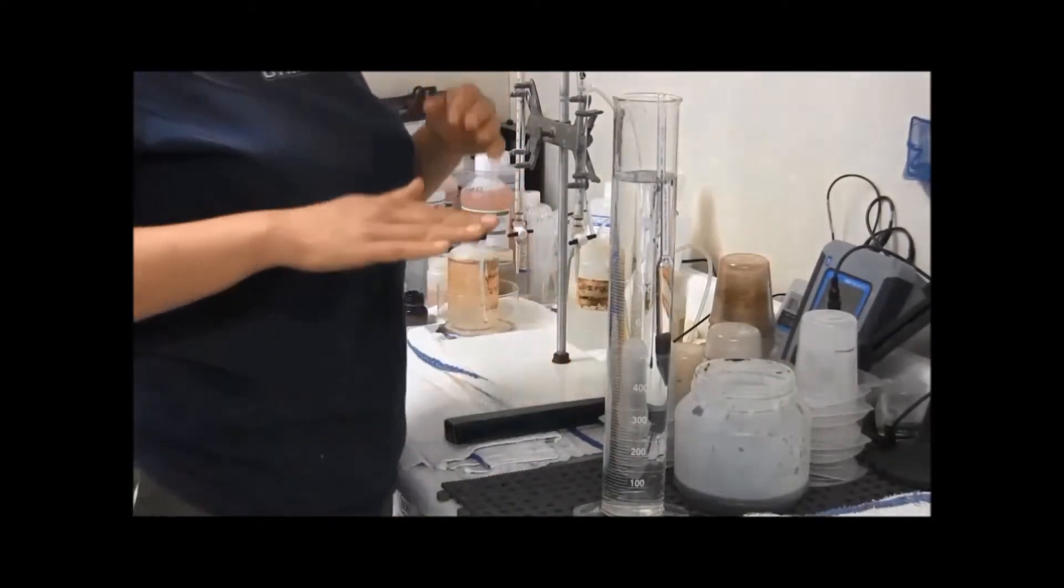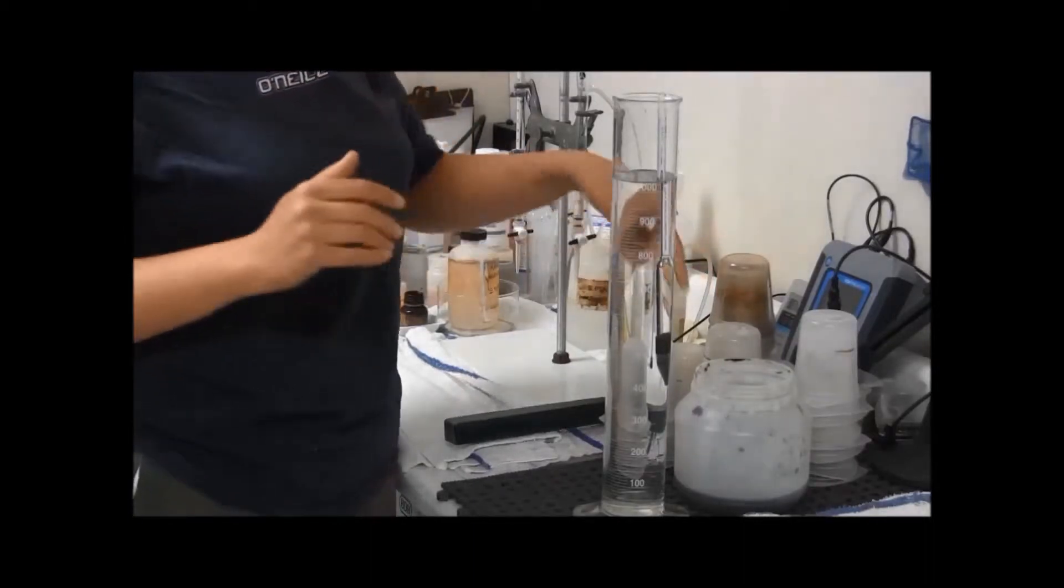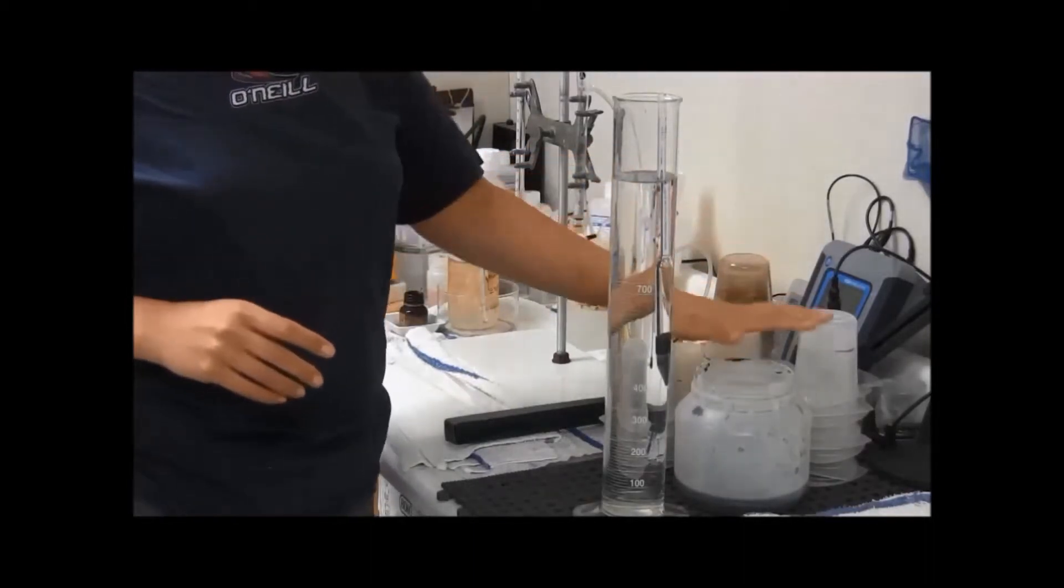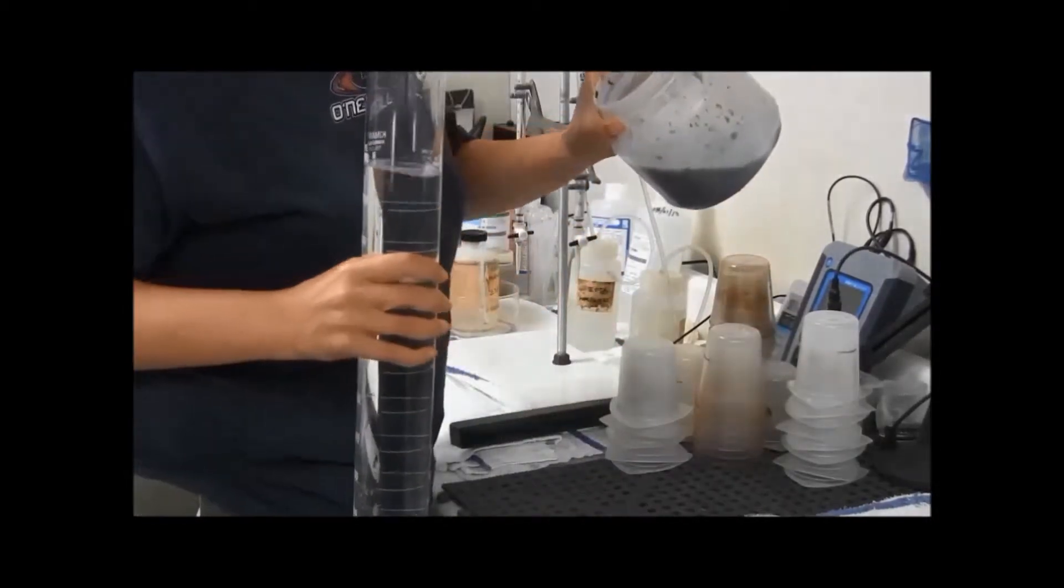We emptied out most everything but the bugs and organic material out of this. We'll pour all of this sample into the container.